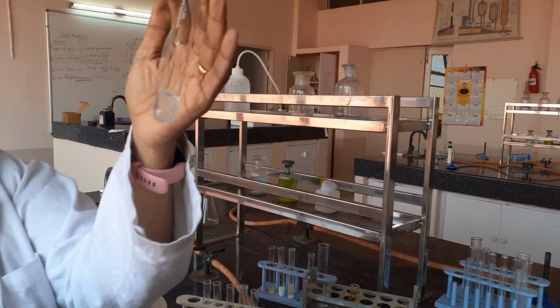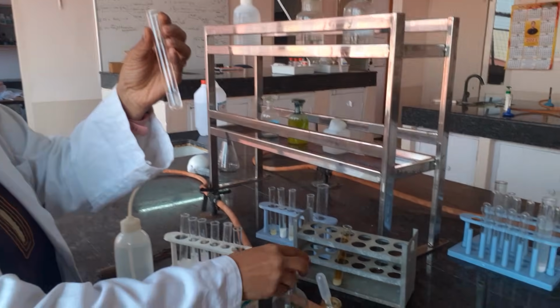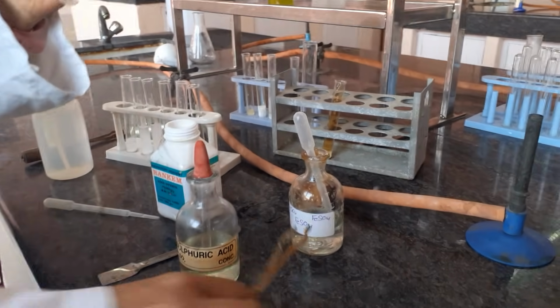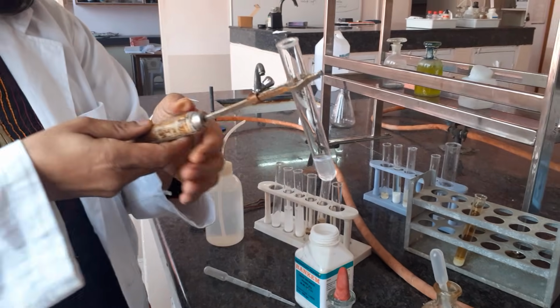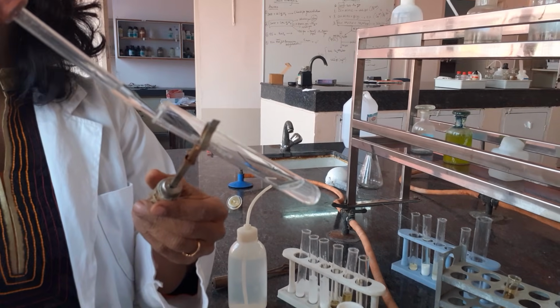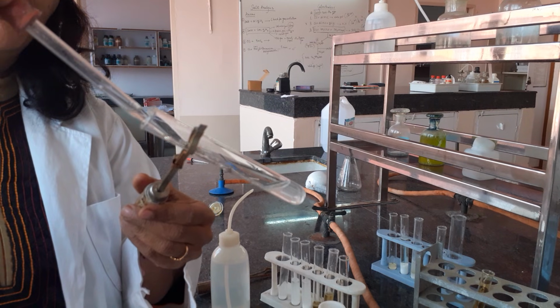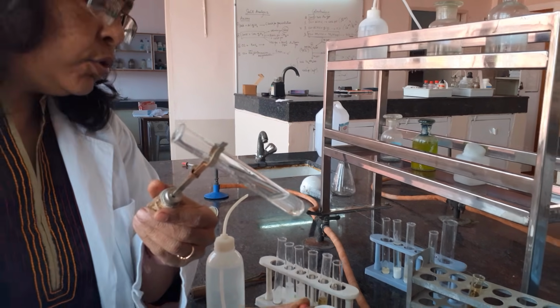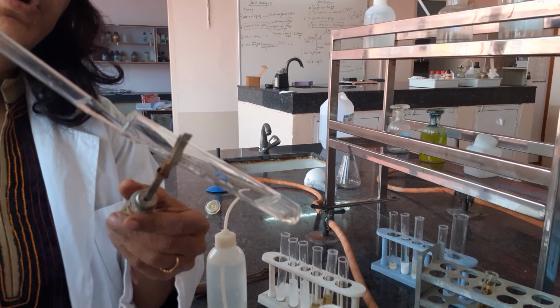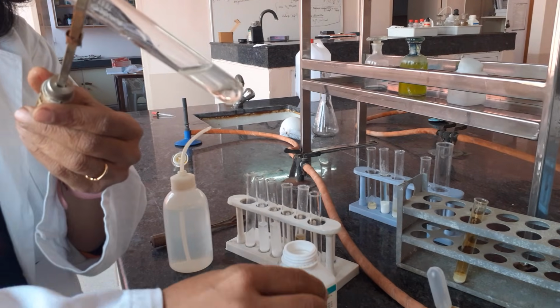Now I will be performing the brown ring test on this. You may discard this test tube. To this solution, start adding concentrated sulfuric acid carefully, slowly, and try to use this test tube holder when you add concentrated sulfuric acid. This concentrated sulfuric acid is to be added from the sides of the test tube. Turn your test tube a bit and start adding concentrated sulfuric acid from the sides of the test tube without much movement. At least one ml should be added carefully, slowly, consciously, without moving much.